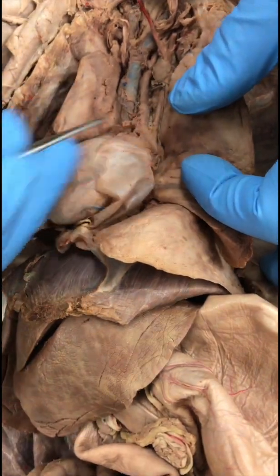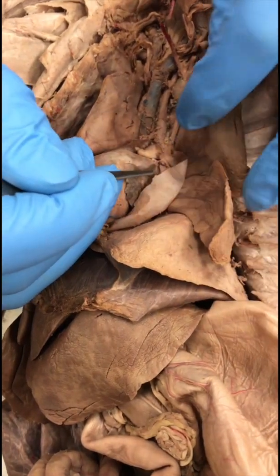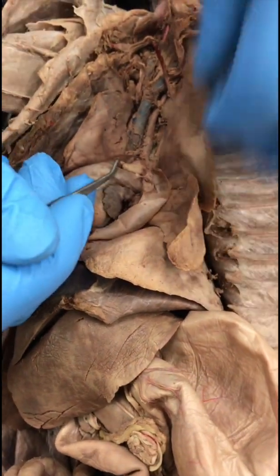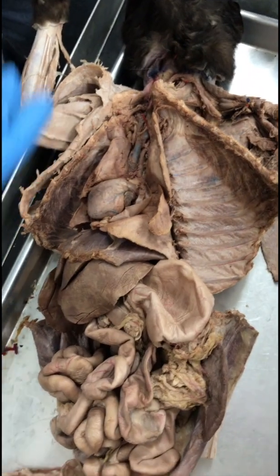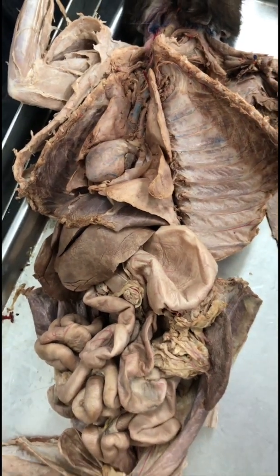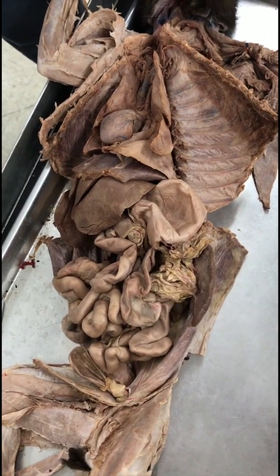Pulmonary artery. Pulmonary artery is not seen here. So the pulmonary artery is entering into the pulmonary trunk here. It will be more easily visible. Pulmonary artery and pulmonary vein will be visible in the sheep heart and the model. And the key to find the pulmonary vein is there will be 3 or 4 vessels entering into the back. So you can see that on that model right there.